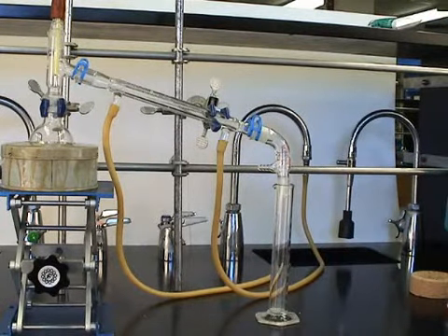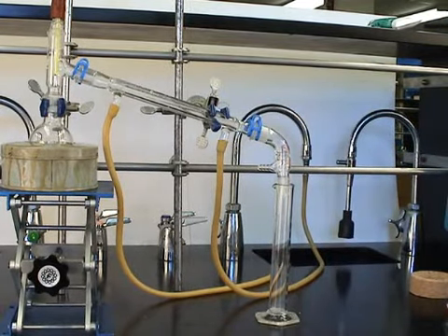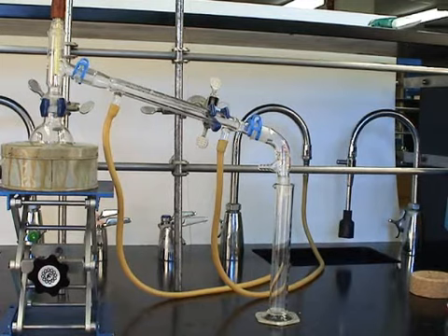Finally, we insert a receiving flask. In this case, a graduated cylinder. And we're ready to go.